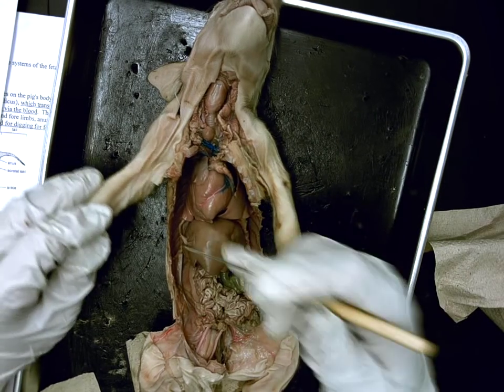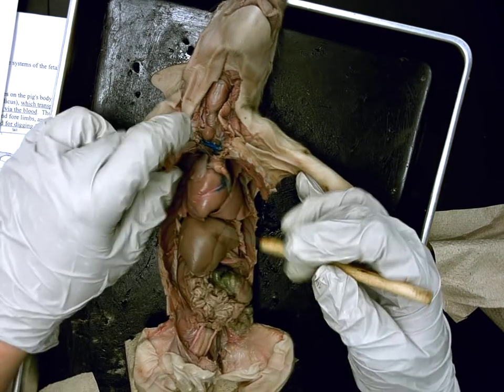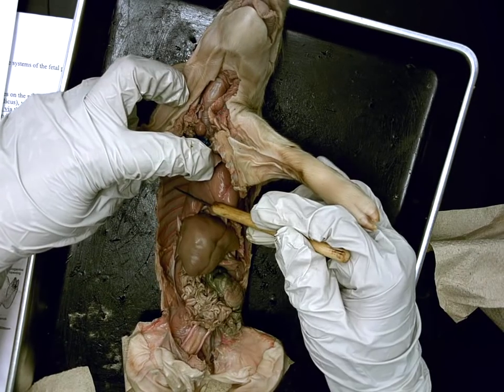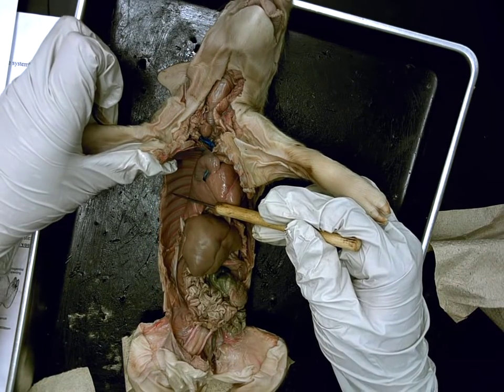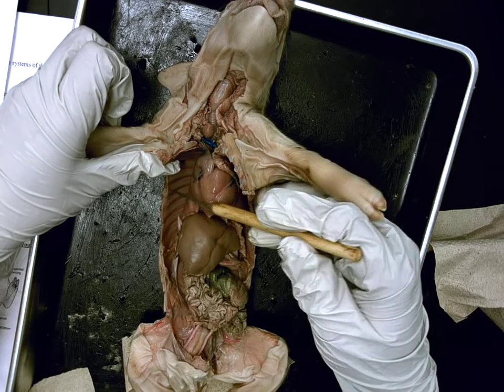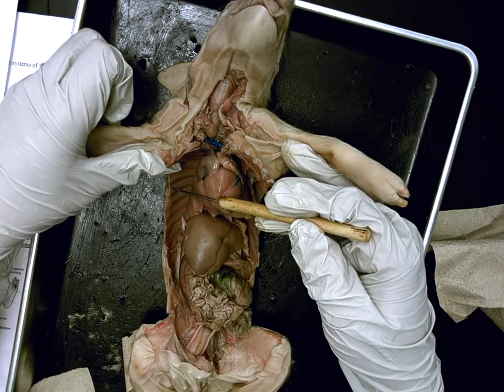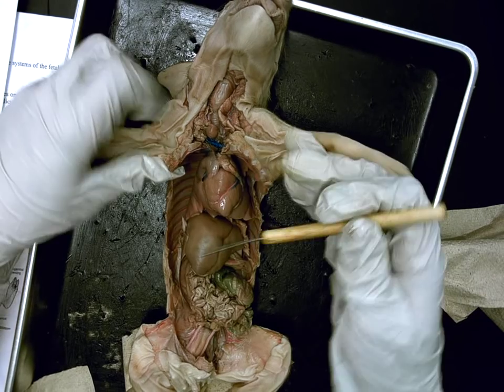Going next, Alexis — if I were to pin the wall and ask what is the shiny material lining the wall? Peritoneum. The function of the peritoneum is always to line the body wall or line the body cavity. Correct.